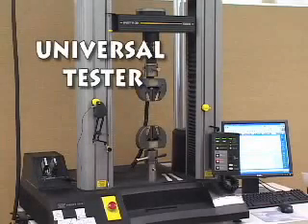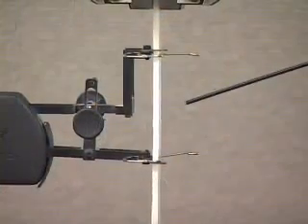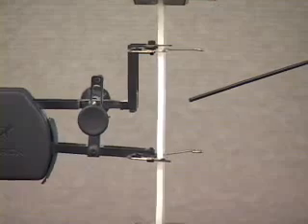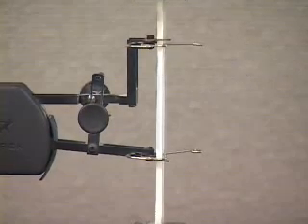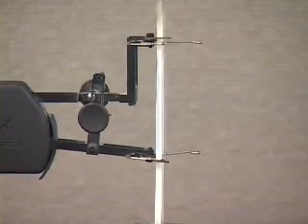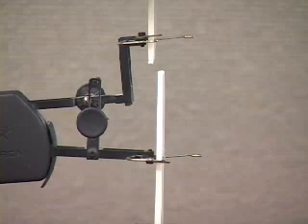This is a universal tester set up to generate tensile property data. Tensile properties are properties that are determined from data collected when a test specimen of a specified geometry is deformed in a uniaxial direction at a constant speed, and the resultant force and elongation recorded until rupture.